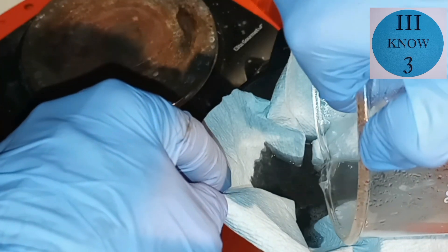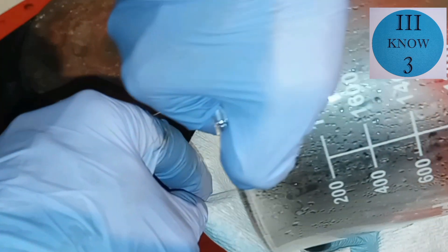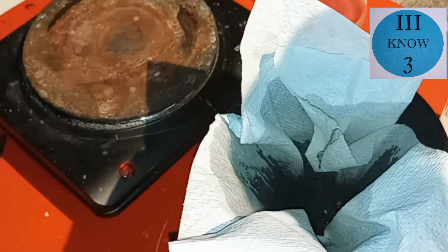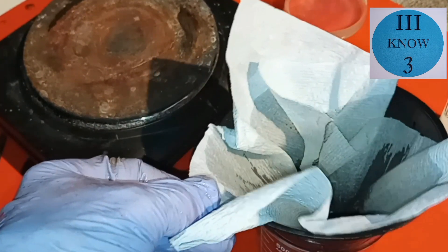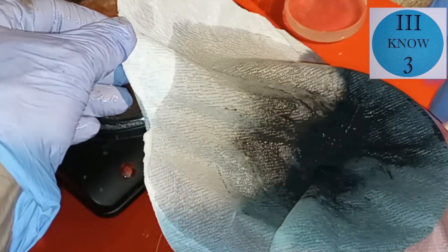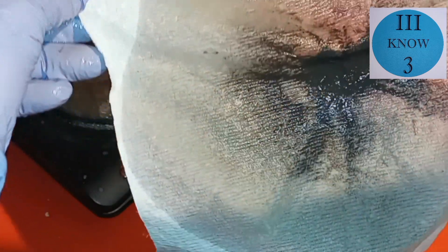but it could also contain antimony and copper. This time, since I only used the hydrochloric acid and didn't add any hydrogen peroxide or other oxidizer, the lead would not have dissolved very much at all into the hydrochloric acid.